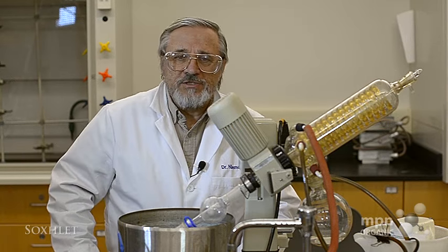Here's what we extracted. Now, those black things in there are the boiling stones we put in to facilitate boiling. Let's see if we can get this to solidify — I've got some ice right here. And there it goes — you can see that with just two passes through the Soxhlet procedure, we did extract out some solid. We know that trimyristin itself is a solid, so if we were to recrystallize this and check the infrared spectrum against trimyristin from a previous procedure, they would probably look the same.